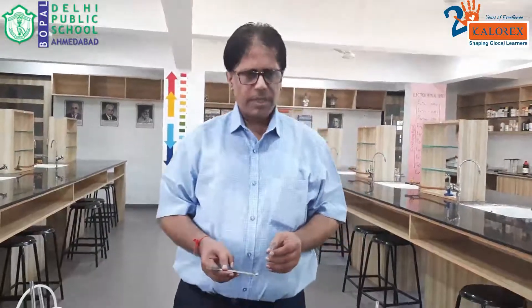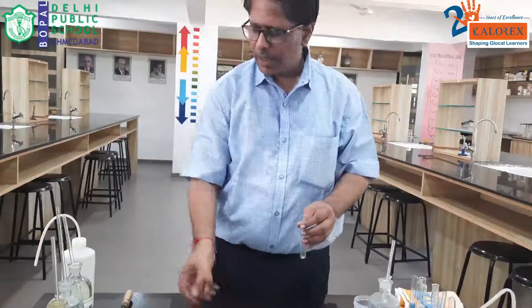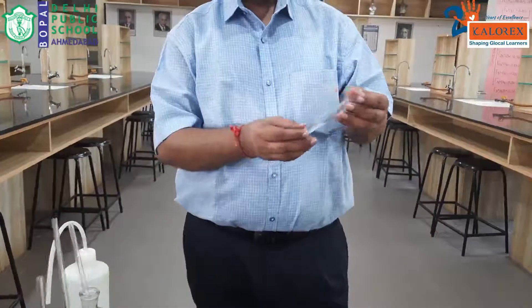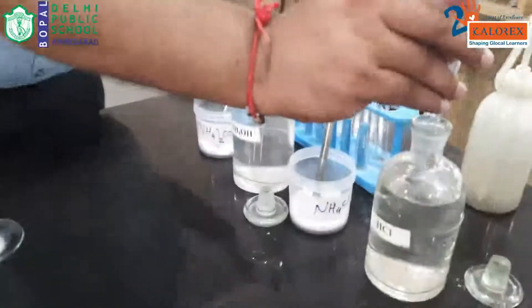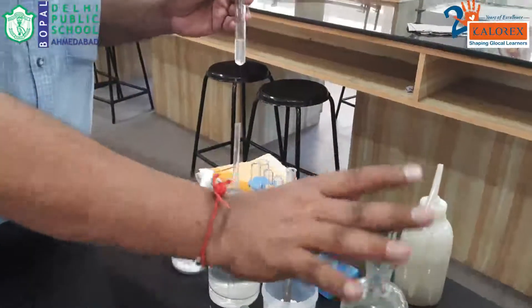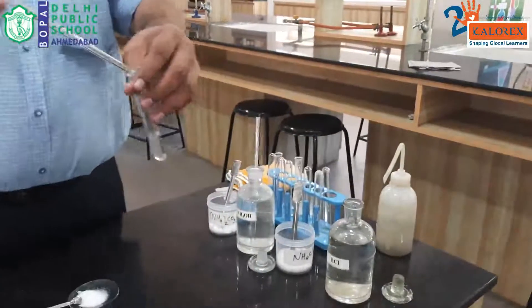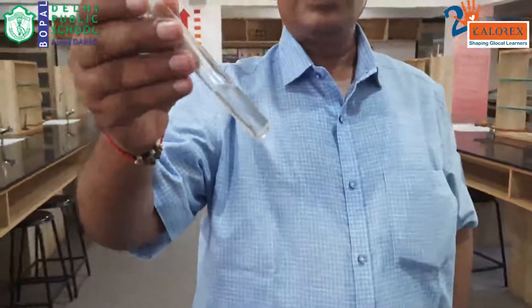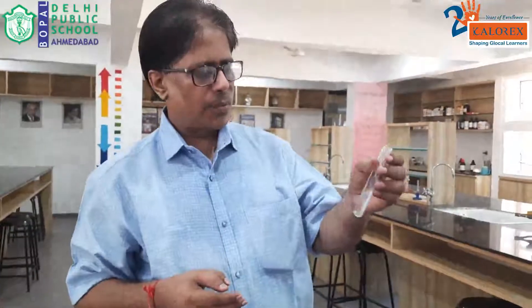The preliminary test is complete. Now we begin with the group analysis of the cation. For Group 1, the reagent is dilute HCl. I have prepared the aqueous solution of the salt — a transparent clear solution — and we are adding dilute HCl to it. There is no precipitate formation and no other observation. The inference is that Group 1 is absent.